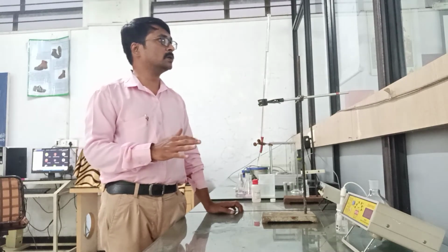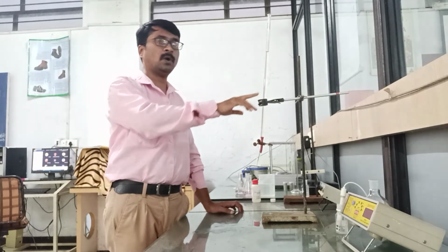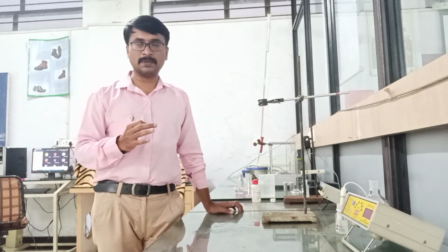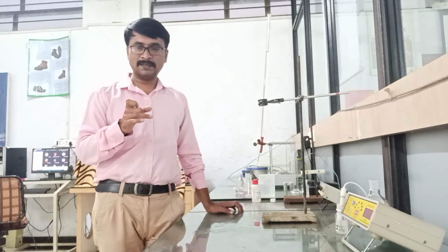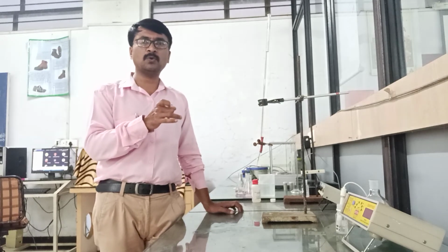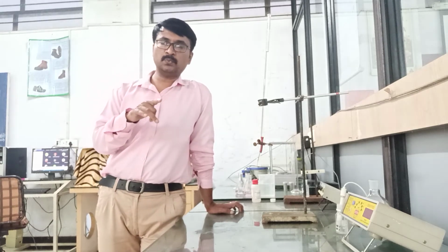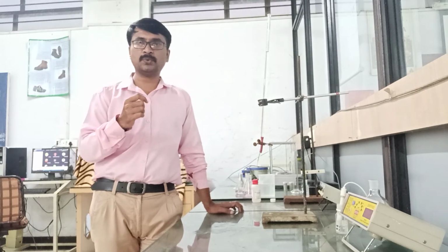So as we have not got the concordant reading, we can use the mean of all these three readings and utilize it for determination of the normality of the water sample by using the formula N1V1 = N2V2. And by determining the normality of the water sample, we can calculate the amount of carbon dioxide present in water by multiplying the normality with the equivalent weight of carbon dioxide, and the equivalent weight of carbon dioxide is 22.